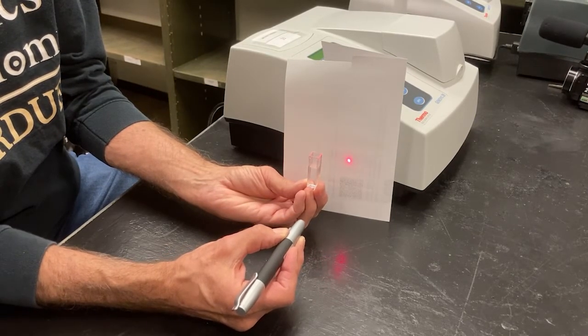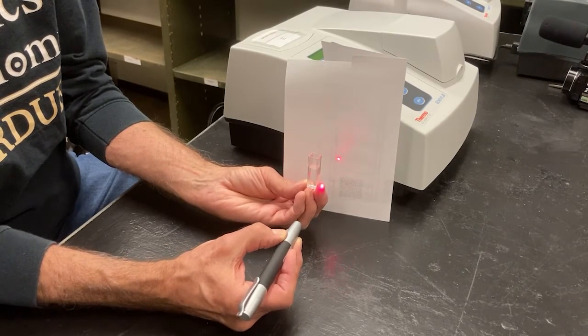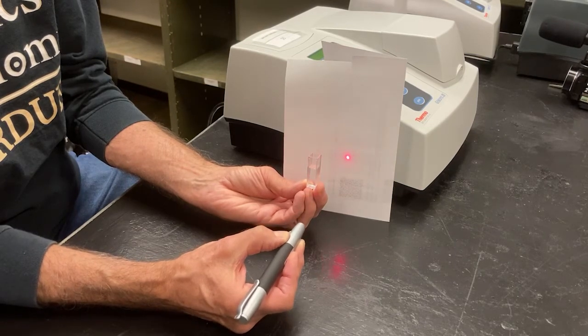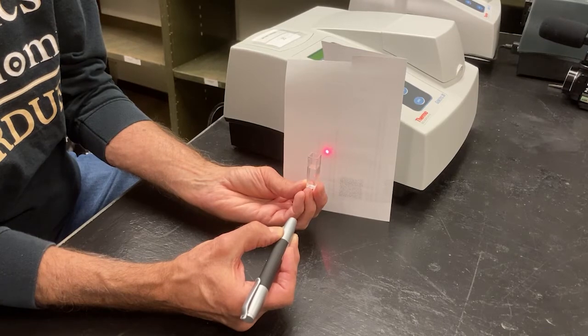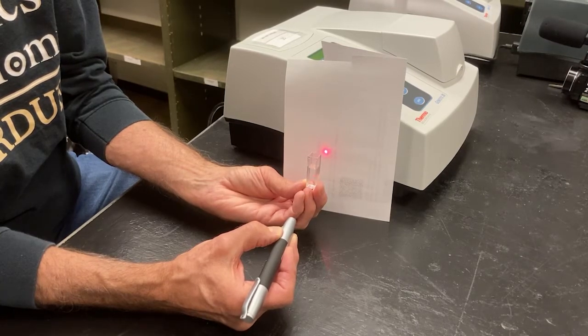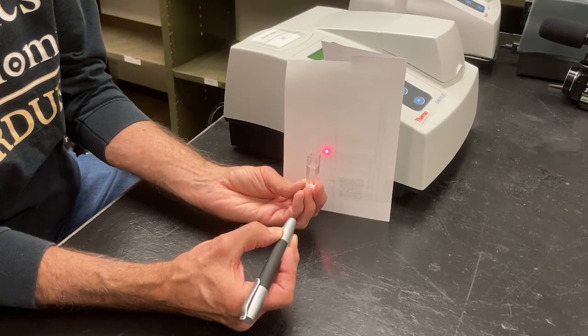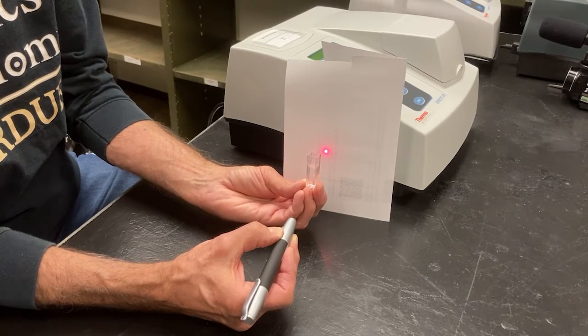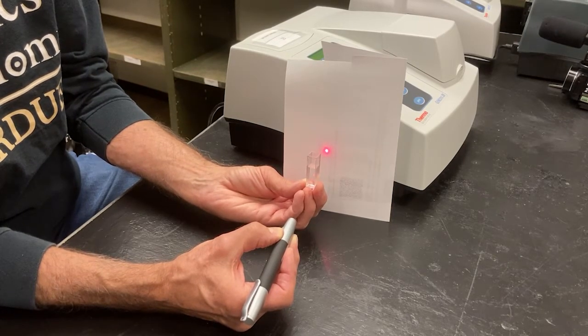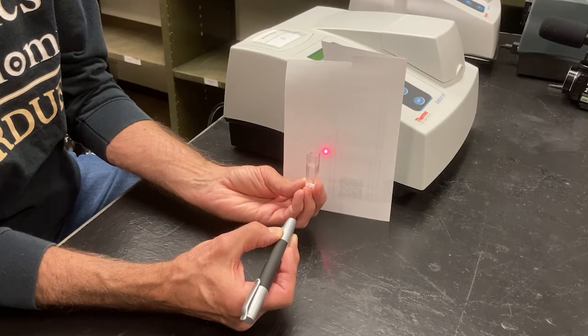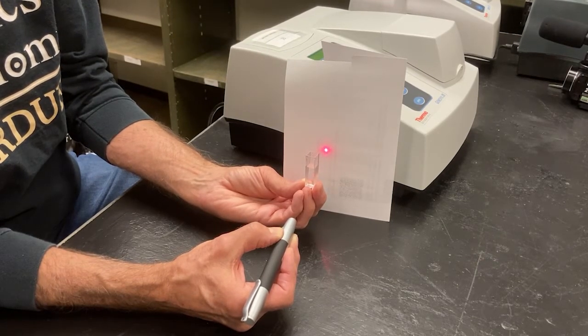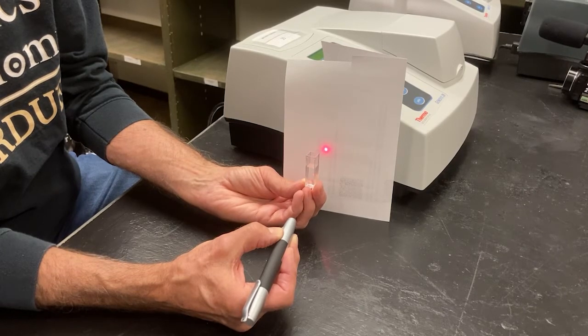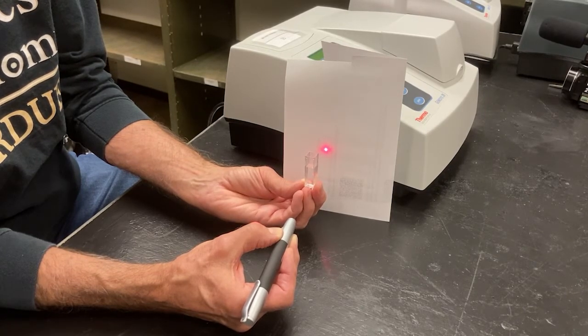Now, let's go to the outside again. Inside. And I don't see a whole lot of difference. It's still the same brightness. So, that tells me that the red light is being transmitted through the water and it is not absorbed. Well, what would happen if it was absorbed, Bill? It wouldn't be as bright on the other side. Sure. You're right. It would be absorbed, meaning some of the light would be stopped by the solution.